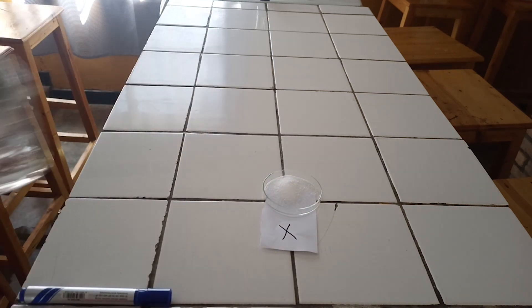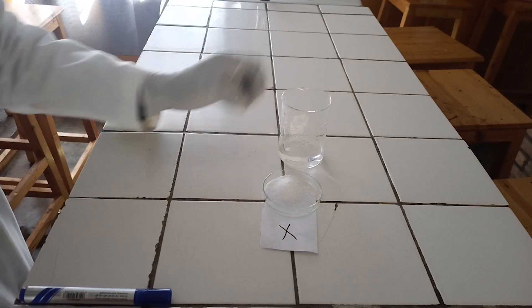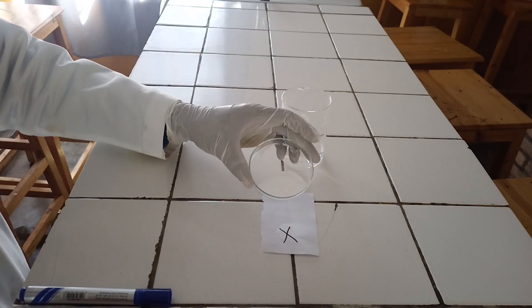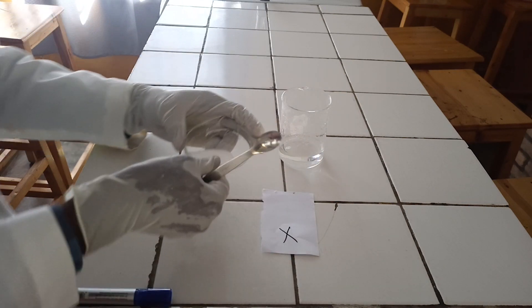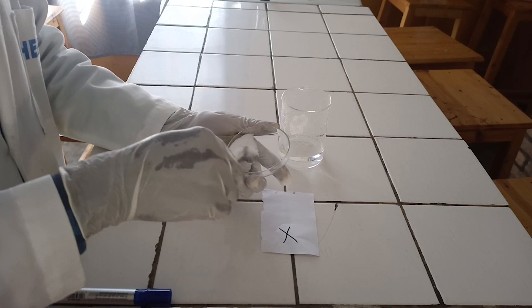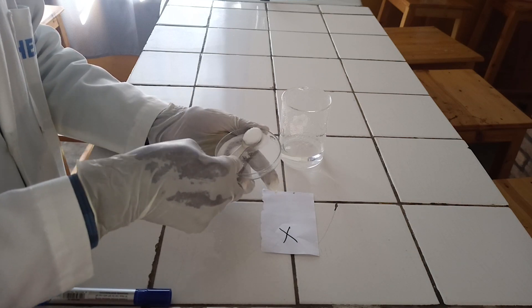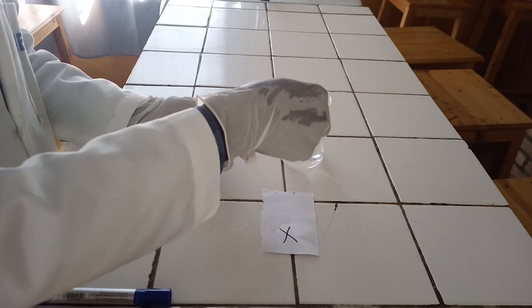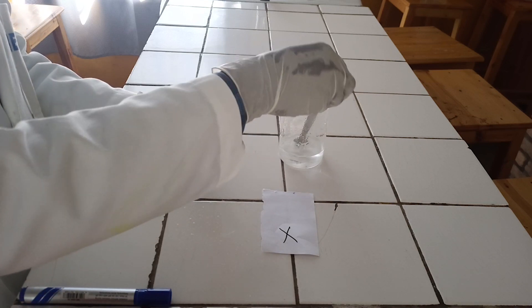First step is observation. Salts of barium ions are white. Second step: dissolve one full spatula of salt in 50 milliliters of water.